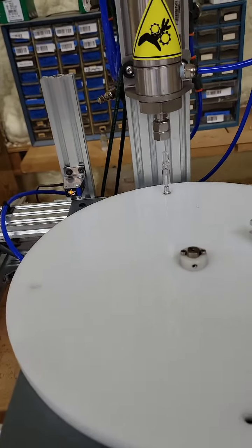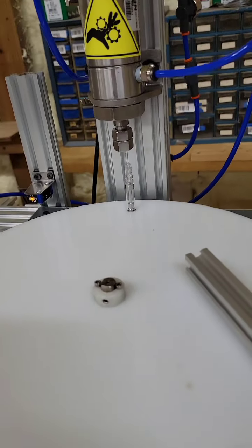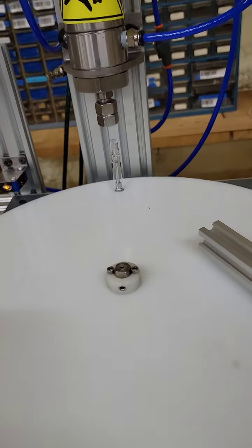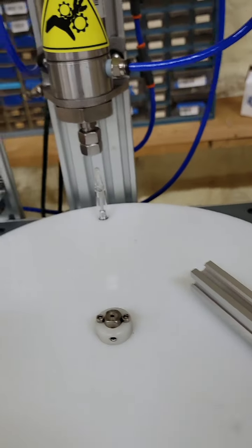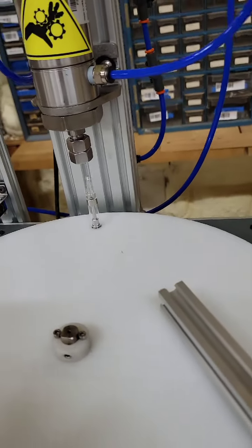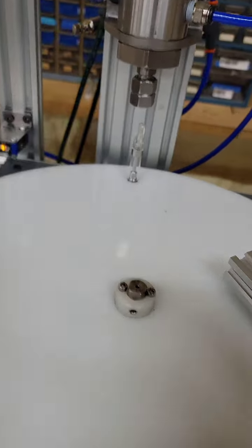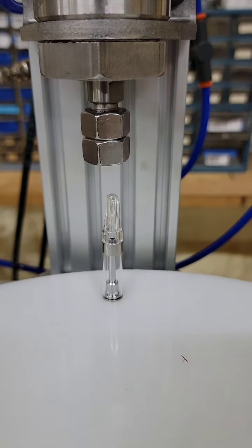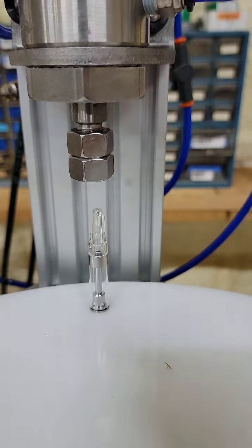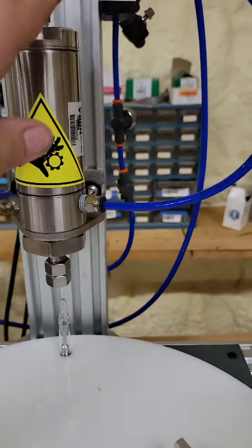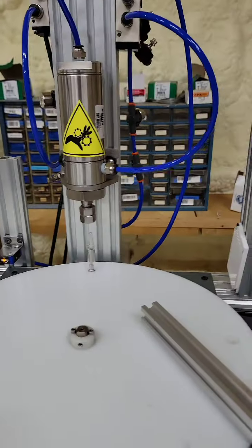So I think if we add a whole bunch of variables, it's just going to get kind of confusing. As far as capper speed, it's pretty much as fast as it'll go without these things wiggling everywhere. So that's all good. Really, your only adjustments are all manual. And one of them here, you can see that the cap's a little bit on this side of the tower. I just have been calling this the tower as I build it.